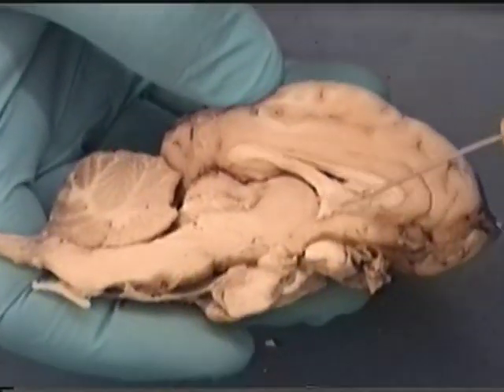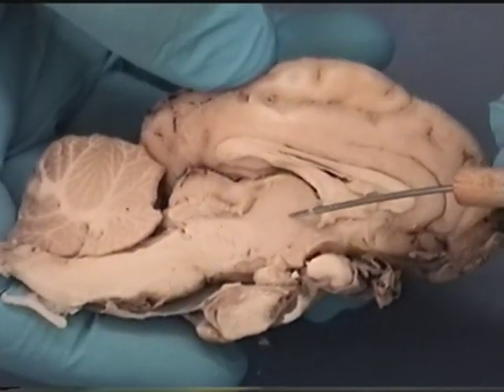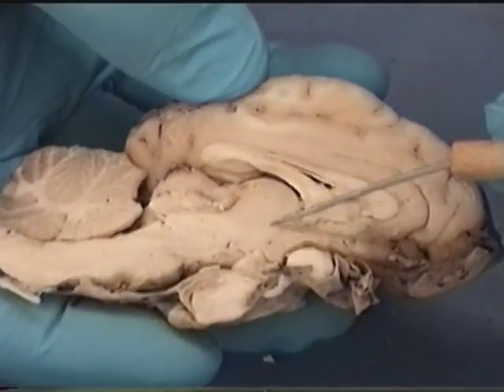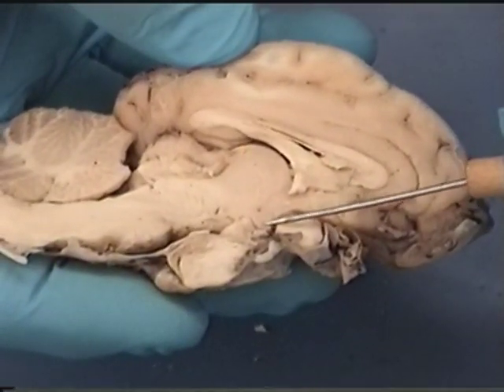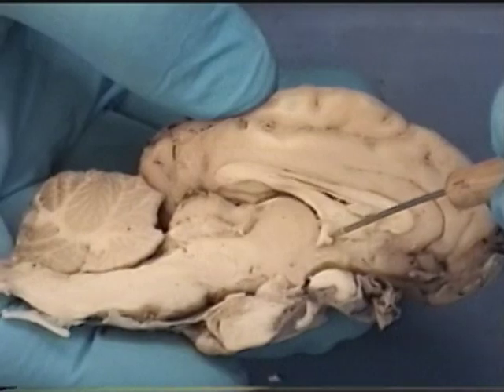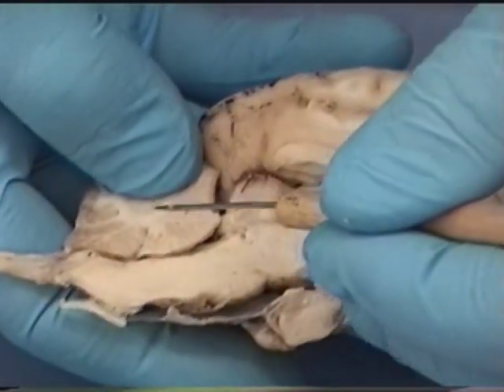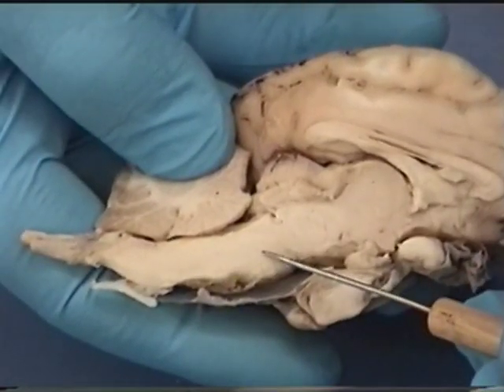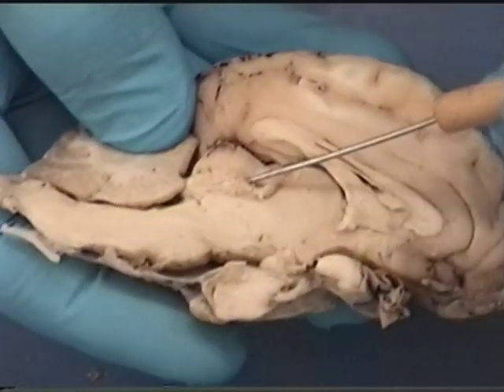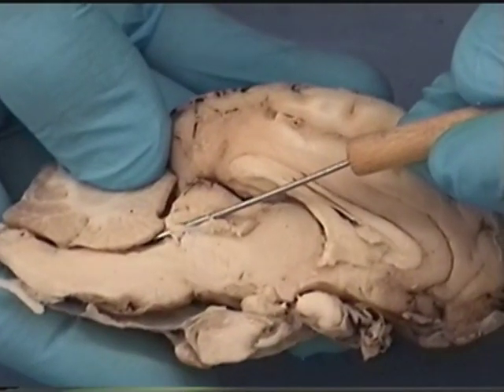Moving beneath the fornix, we see a large rounded area which is the intermediate mass of the thalamus — quite large in sheep compared to humans. It connects the thalamus, which is the tissue lateral to this. This area is the hypothalamus, and the infundibulum is attached to the hypothalamus, establishing the relationship between the hypothalamus and the pituitary. The depressed area here is the third ventricle. The area between the cerebellum and the back of the medulla oblongata and pons is the fourth ventricle. This little groove connecting the third to the fourth ventricle is the cerebral aqueduct.